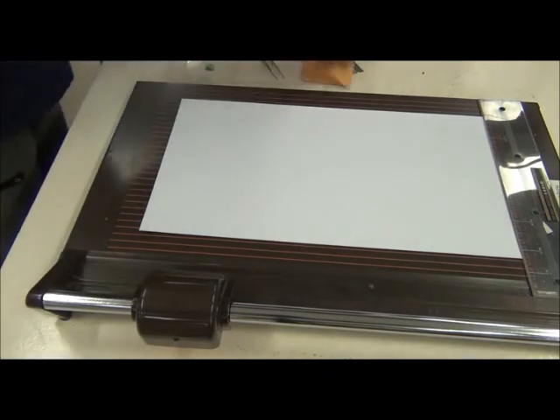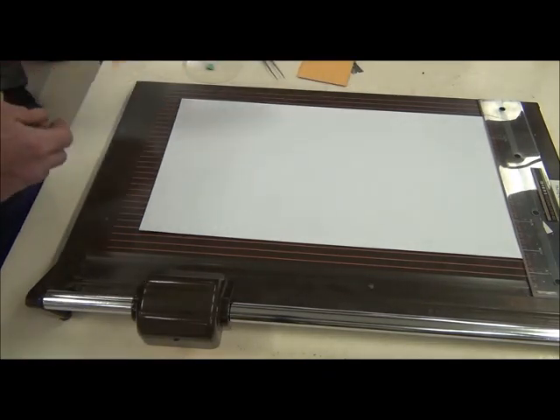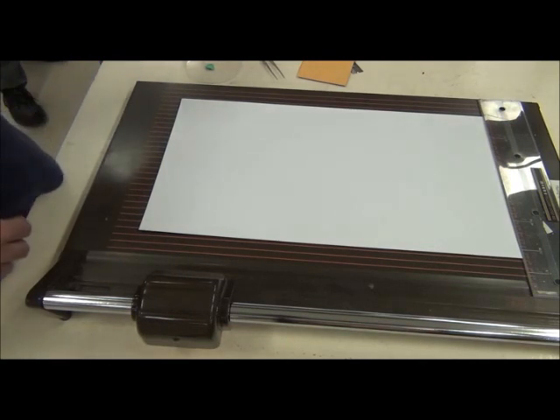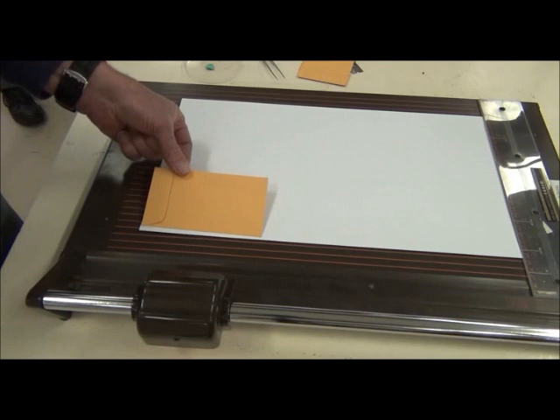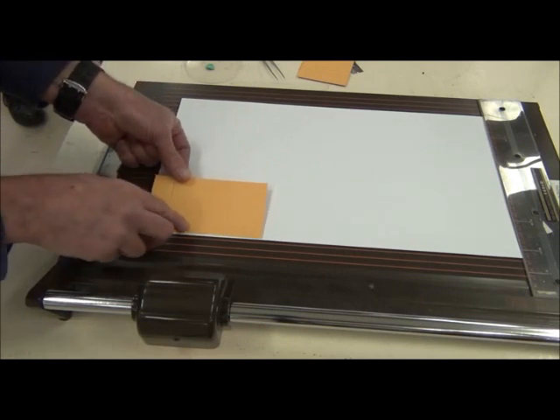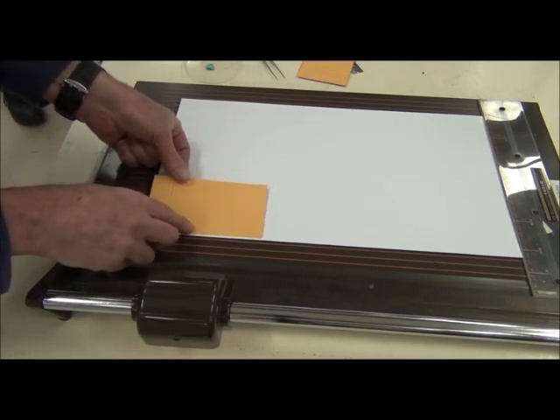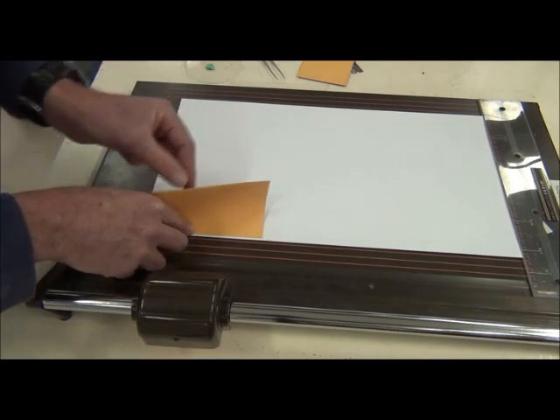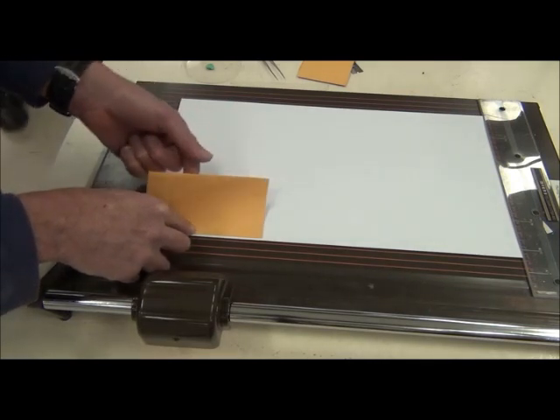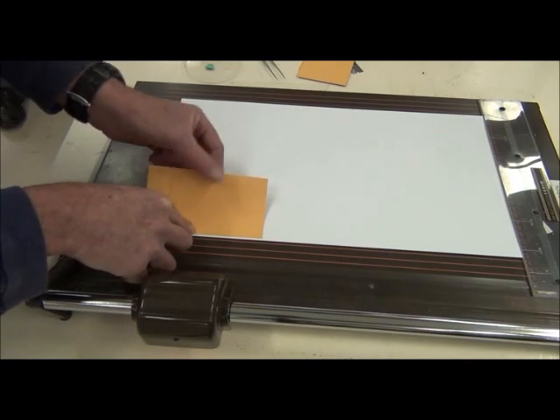Now normally at this stage I'd have the labels ready. So I'm going to pretend if you like that I've got a label ready by just putting that there. So if I had this label, that's where I would put the label. I'd put it in the lower right hand corner.